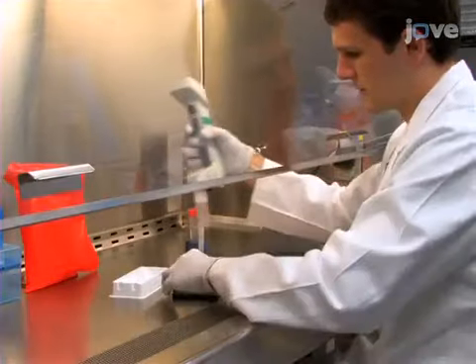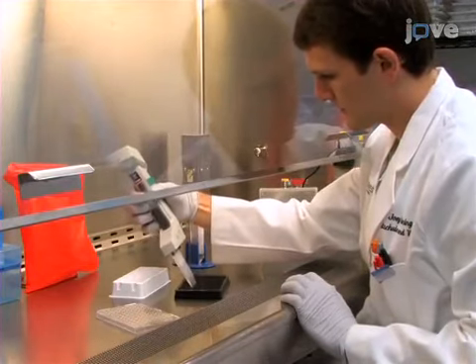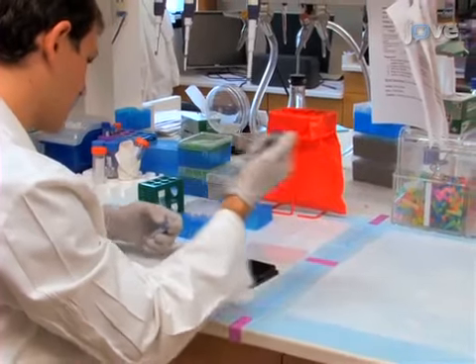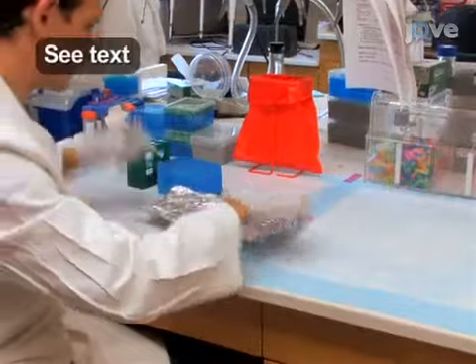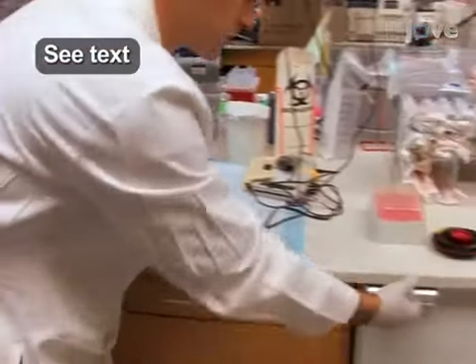This procedure begins with cell culture and cell fixing as described in the text protocol. Stain the fixed cells using the specific primary antibodies, fluorescently labeled secondary antibodies, and other fluorescent stains that can be found in the text protocol.